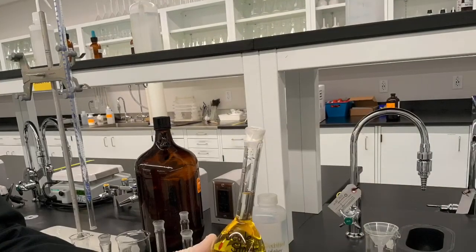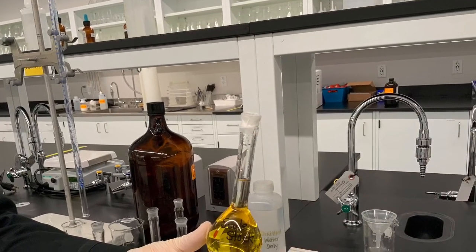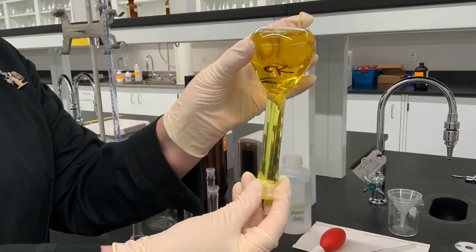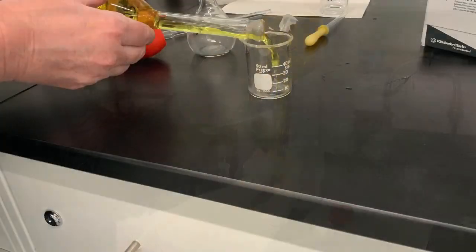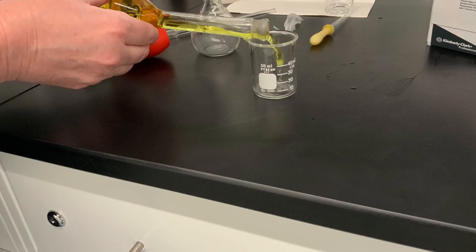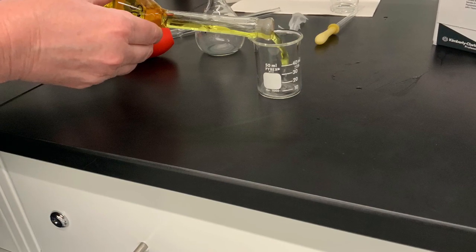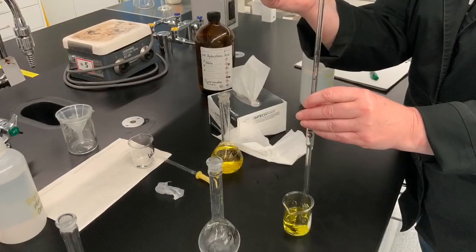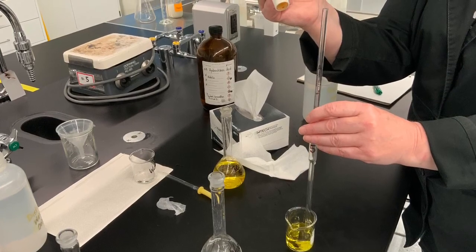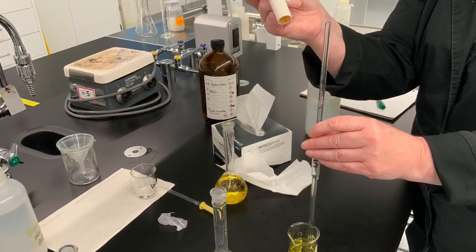When the volumetric flask is filled like this, it's a bit difficult to swirl it, so we added some parafilm and inverted the flask to ensure perfect mixing. Now all of our digested sample is in the 100 milliliter volumetric flask, but it is still too concentrated for the spectroscopy, so we dilute it by factor 20, and for that we pipette 5 milliliters of this solution into another 100 milliliter volumetric flask.